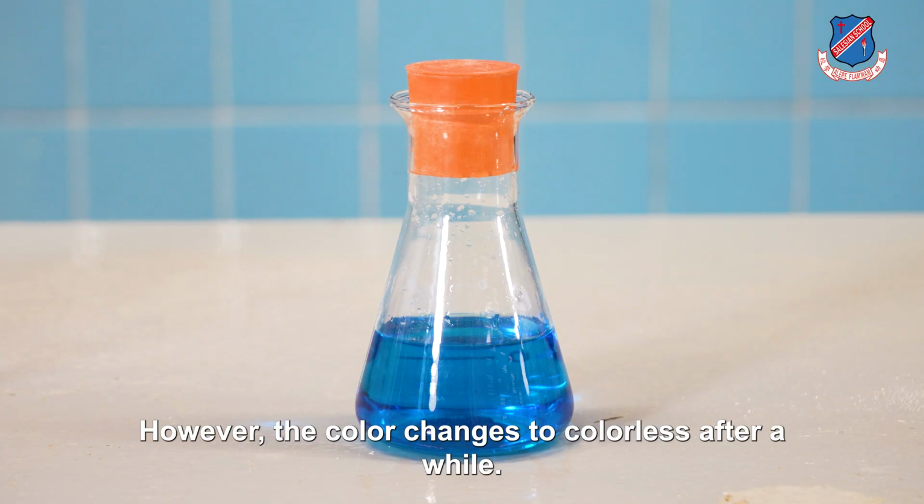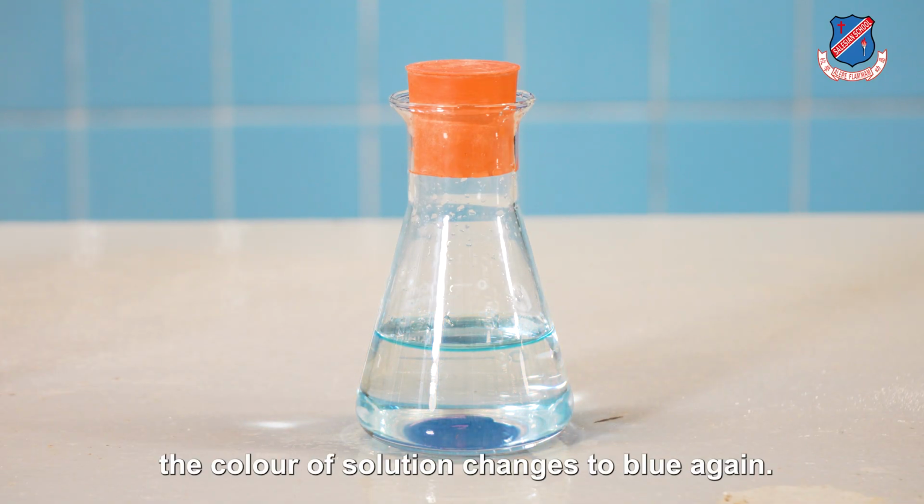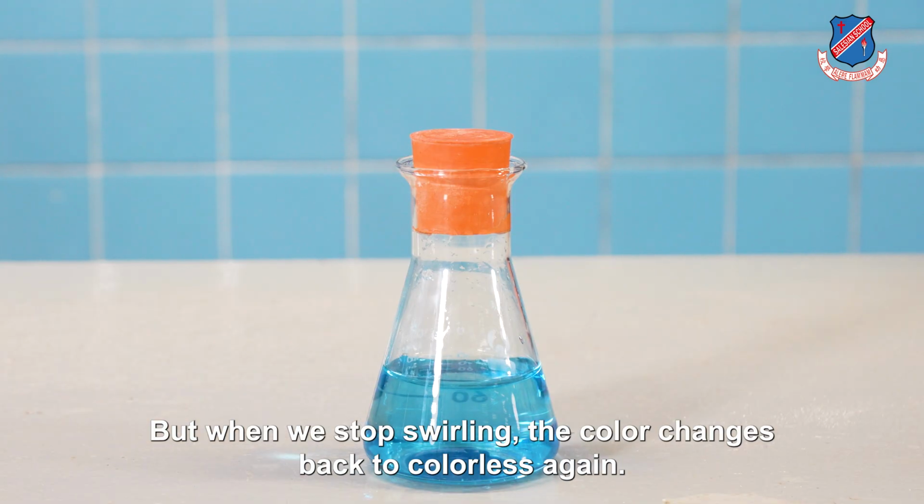However, the color changes to colorless after a while. When the solution is swirled, the color of the solution changes to blue again. But when we stop swirling, the color changes back to colorless again.